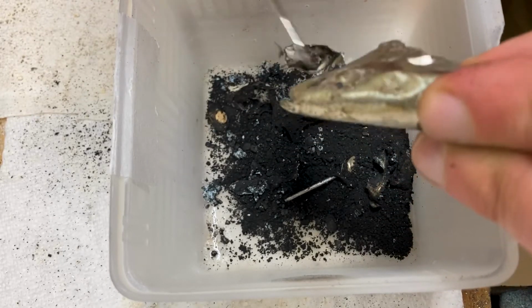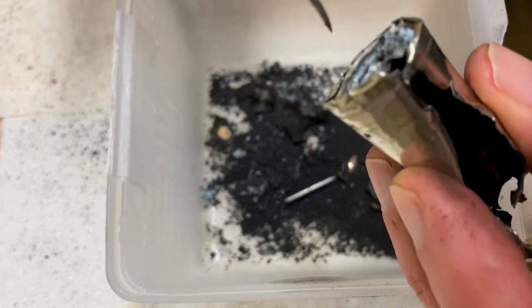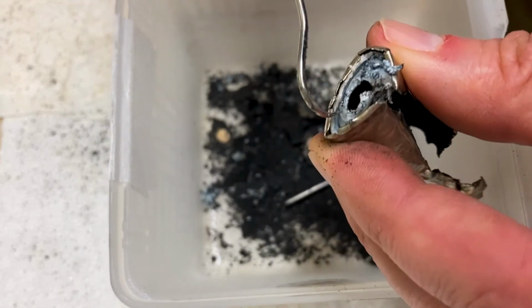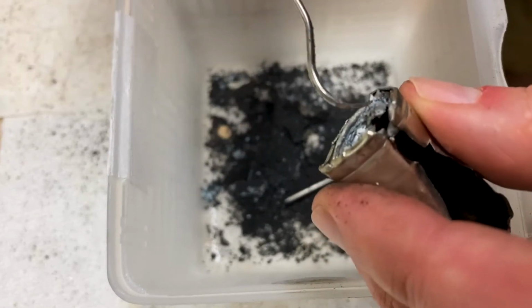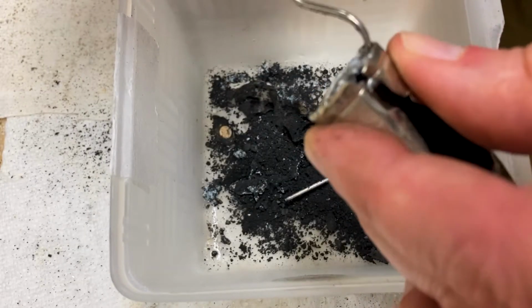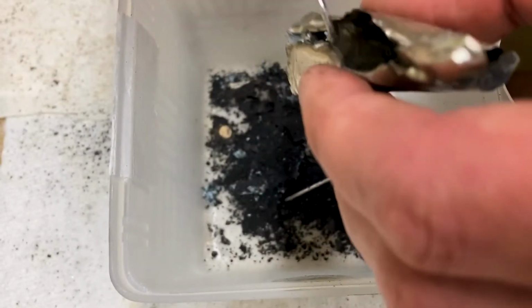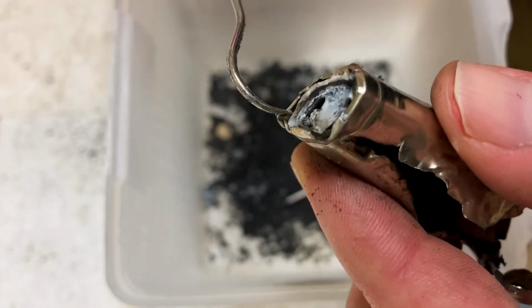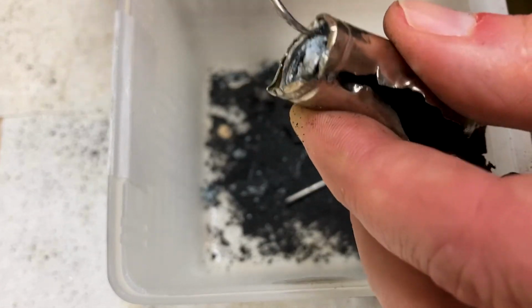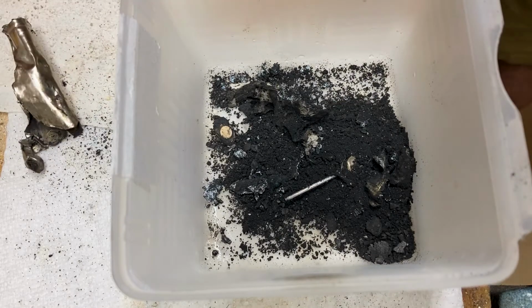Why it was no longer working well in my mouse, I don't know, but that's a subject for a different day. And what I want to be able to do is, if you see all this whitish gray stuff here, that is the zinc oxide. If it's more of a dark gray, silverish color, then that would be the original zinc powder. So I do think the battery was mostly used up, but probably my mechanical encouragement got some chemicals mixed together that weren't going to do so efficiently in the original form of the battery. Don't know that that's of much use because it would just heat things up, but that's what we can do with that.